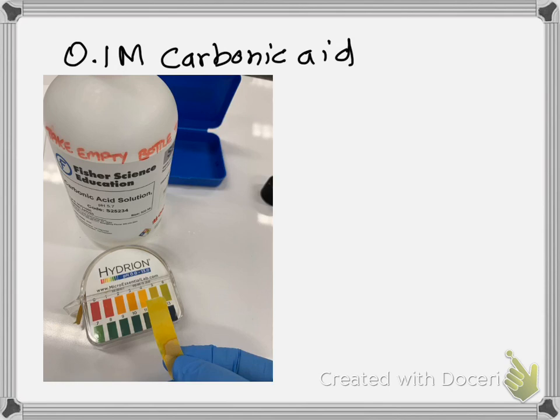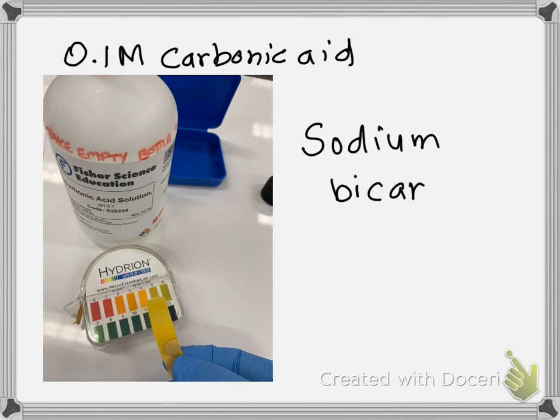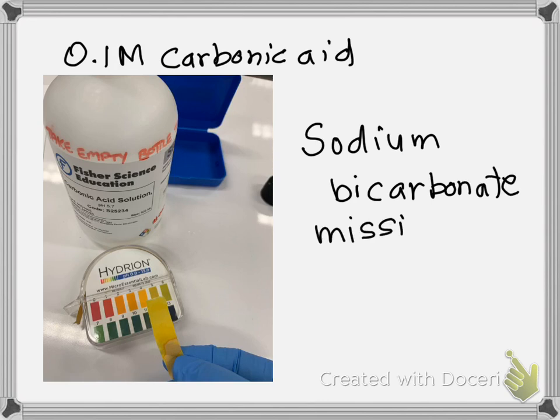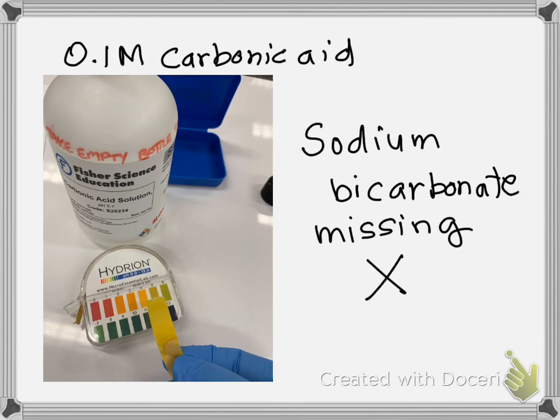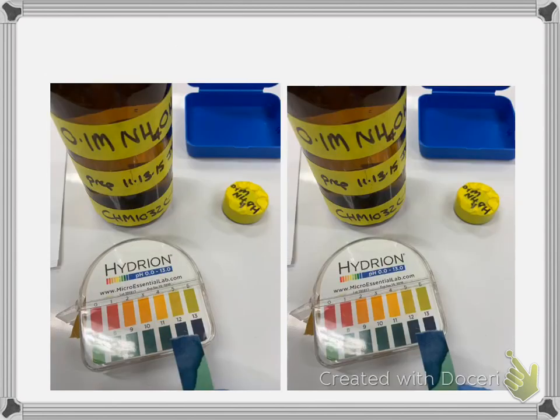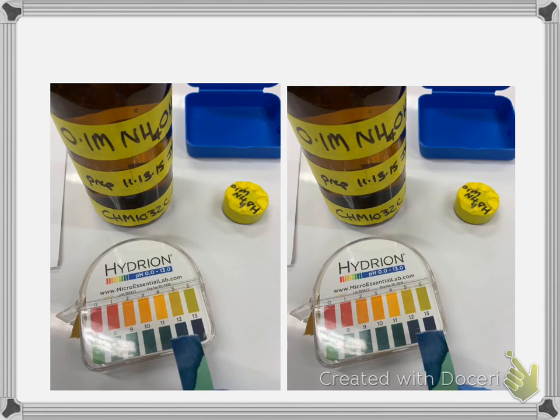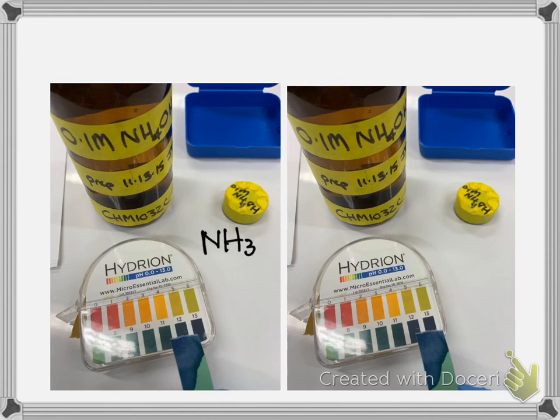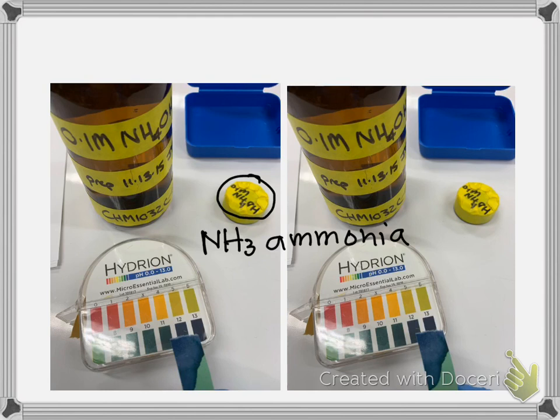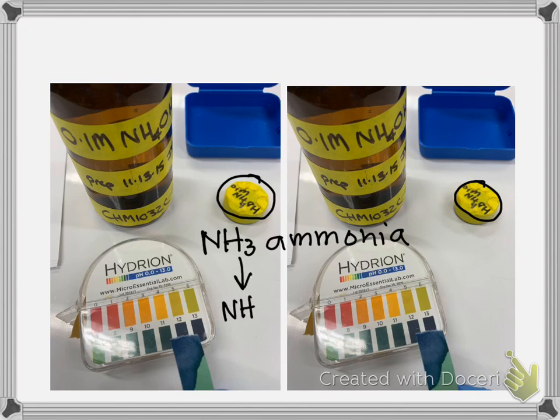After I got home, I realized I did not do sodium bicarbonate — someone came into the lab while I was working and I lost track. So just put an X in that box. Then I did two pictures of the same thing for NH₃, or ammonia. You may ask why it's written as NH₄OH — when ammonia is in water, that's how we write the formula, so it is correct.